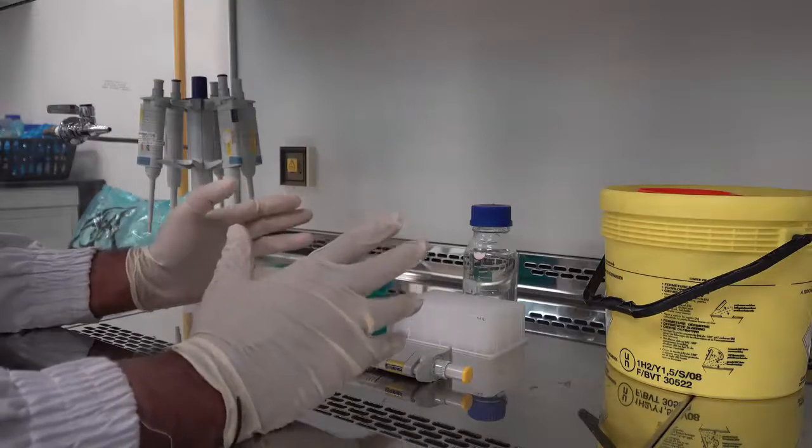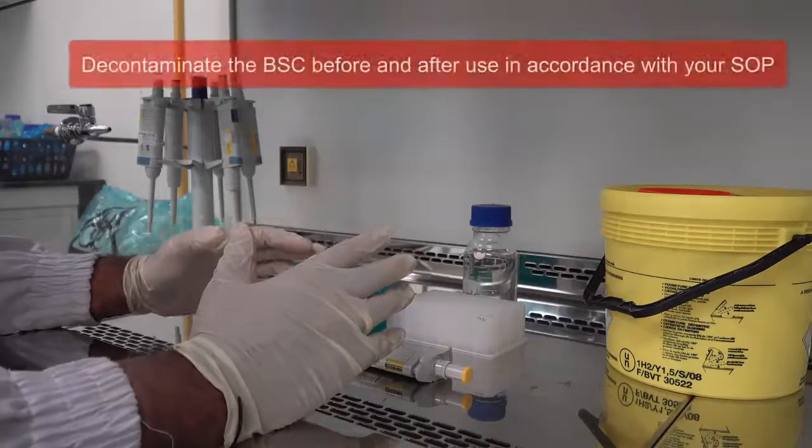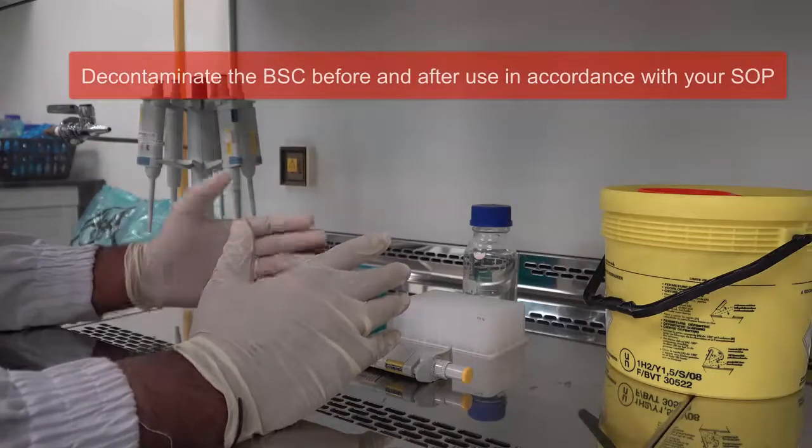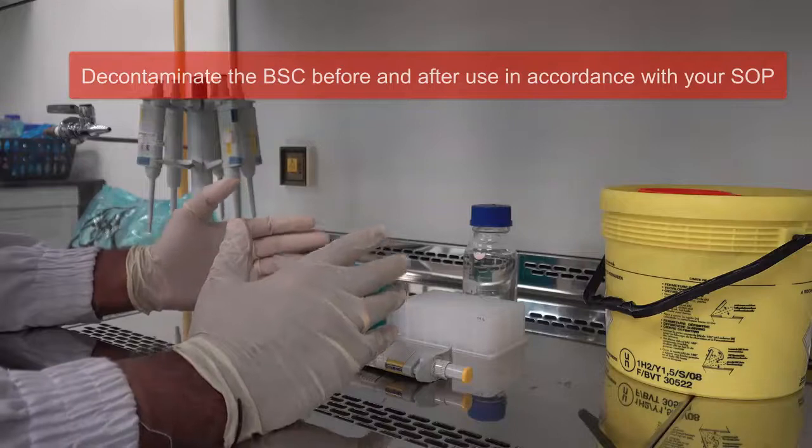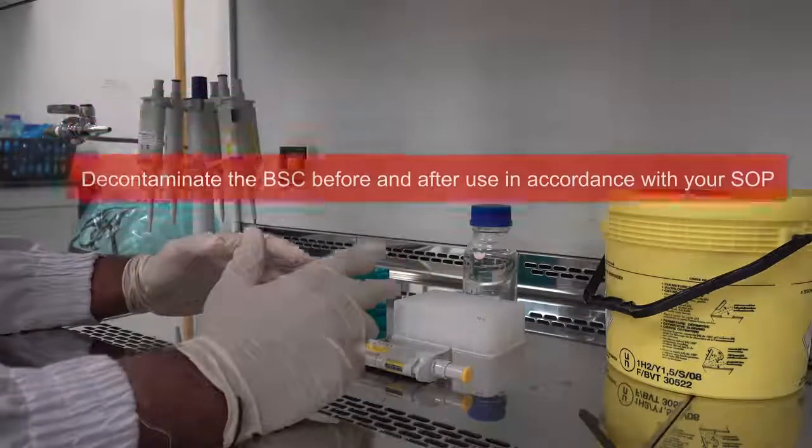Now biological safety cabinets must be decontaminated prior to use using a specified sterilizing agent as well as ultraviolet light and disinfected post usage by using the same sterilant.